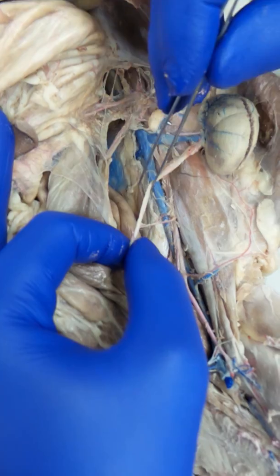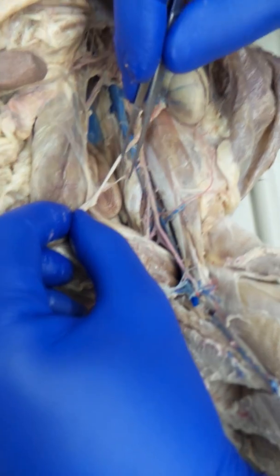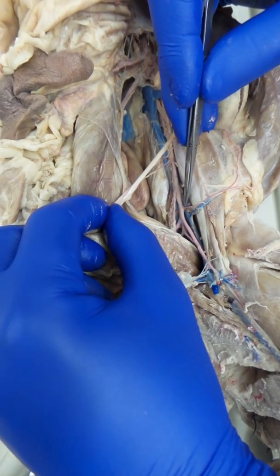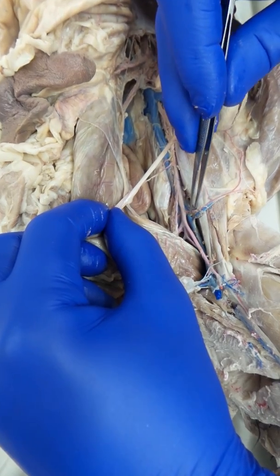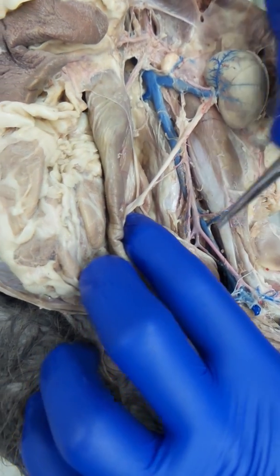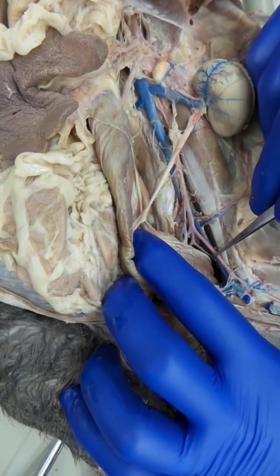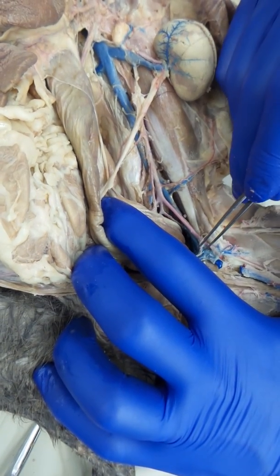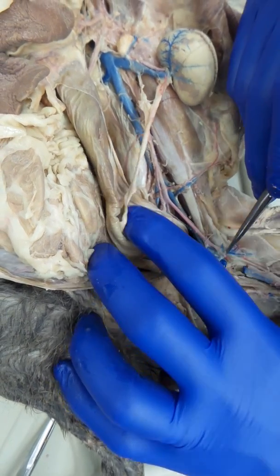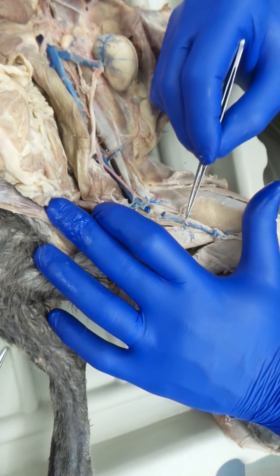I cut the ureter so we can see some of these other structures. The next major branch we're looking for — we have our spermatic artery right here, we're lifting up the ureter — here's the inferior mesenteric, and then we're looking at both the artery and the vein. These are the iliolumbars. From the iliolumbar, you can see how things start to branch off to the legs. With the artery, this is the external iliac artery, and it's called external iliac until it gets to this little branch right here — that's the deep femoral. From the deep femoral, that pipe continues on as the femoral, until it comes to this little branch right here, which is the proximal caudofemoral.